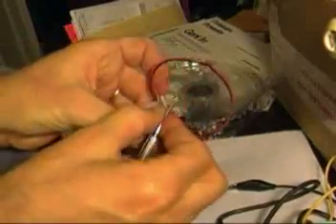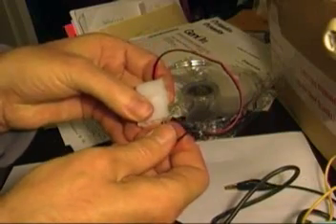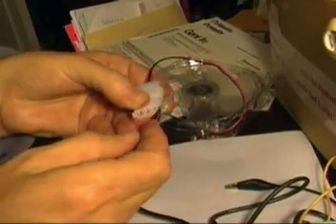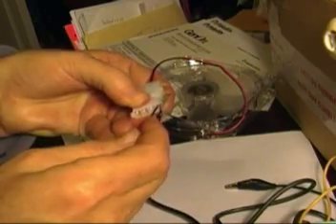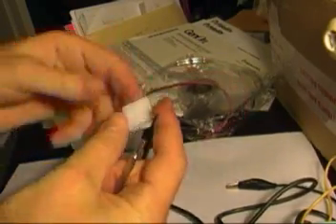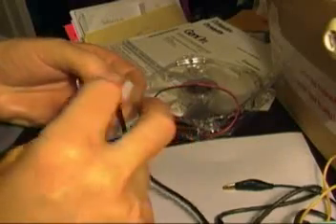Now I'm making sure that I'm lining up the red to the red and the black to the black, snapping this in with a tiny screwdriver — like a jeweler's screwdriver or whatever you call it — just a very small screwdriver. If you have one of those, that would be great for this job.